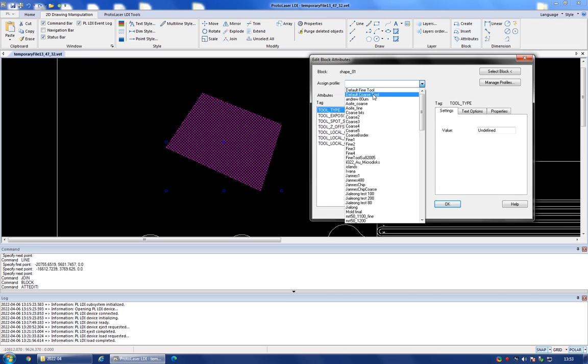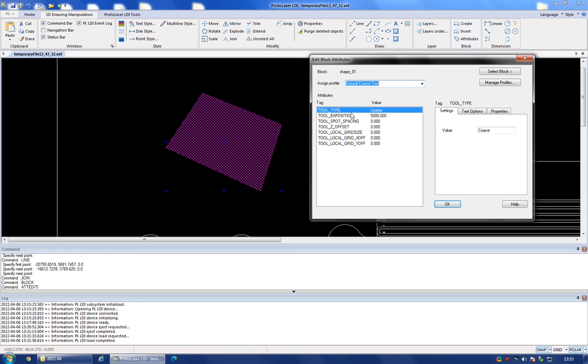Okay, so I'm going to select the default coarse tool, and you will see that this will initialize some of the values that are in the attributes section. So the two values that you really care about are the tool type, which is set to coarse, and you can edit that here. And you should only input the two keywords, either coarse or fine. And I'm going to leave this at coarse because this is the tool that I want to use.